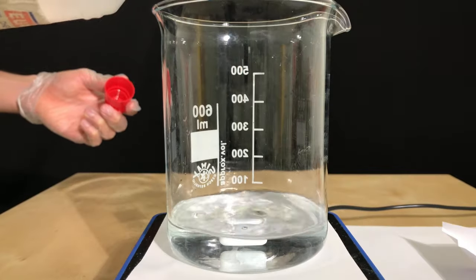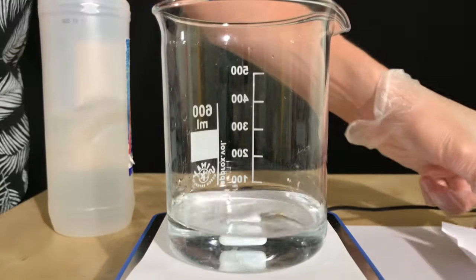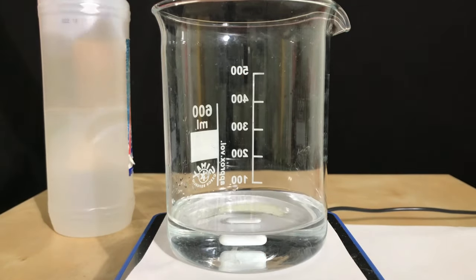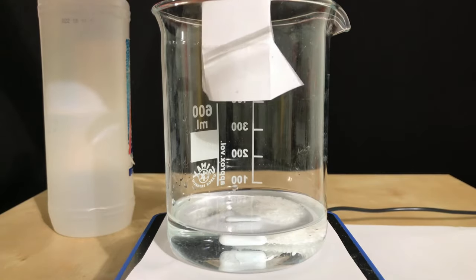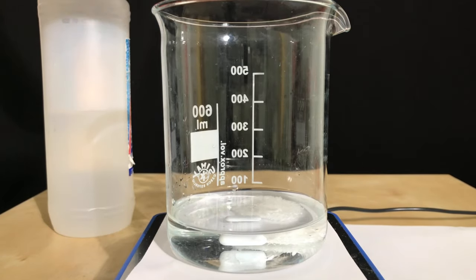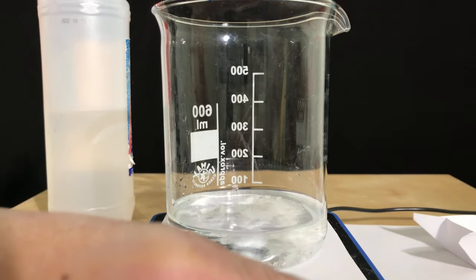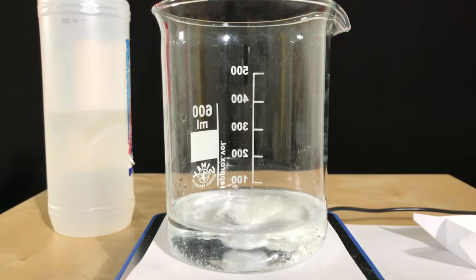In order to begin with the actual experiments, about 100 milliliters of distilled water were added to this large beaker. Afterwards the mercury chloride was dumped in. I ended up adding about 100 additional milliliters of distilled water because mercury chloride is only poorly soluble in water. Even with stirring it took about an entire hour until all of the mercury chloride had finally dissolved.